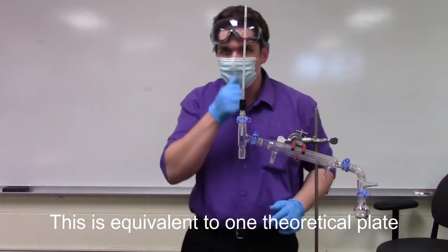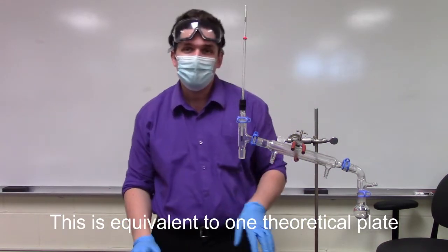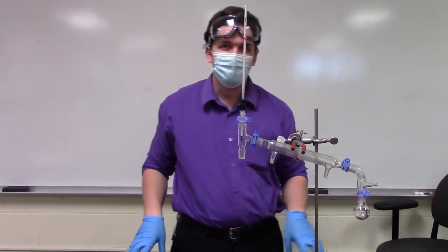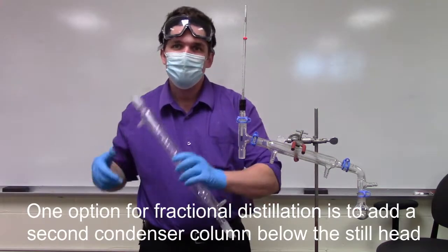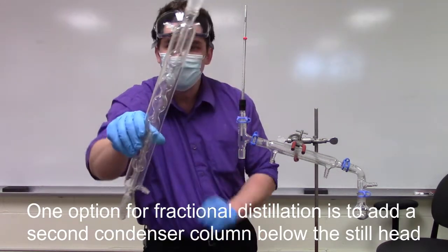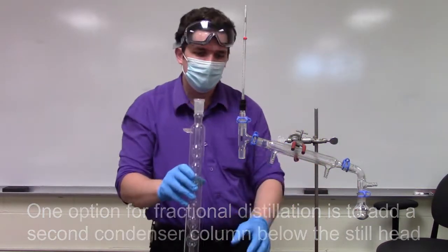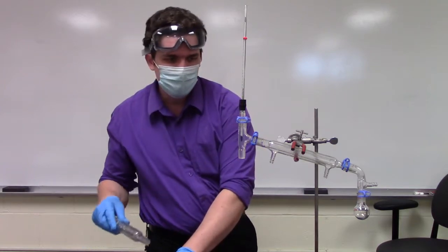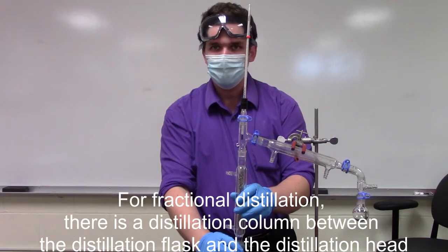Now, to switch this to something like fractional, there's two ways we can do it. One is that we can just add a condenser column, and this is going to be like a fractionating column because it's going to have multiple surfaces for it to condense onto. Or, if you're rich school, you've got a nice fractionating column like this. It actually has a bulb for each theoretical plate. So the difference between a simple and a fractional is that you're going to attach another distillation column to the distillation head and attach your flask there.